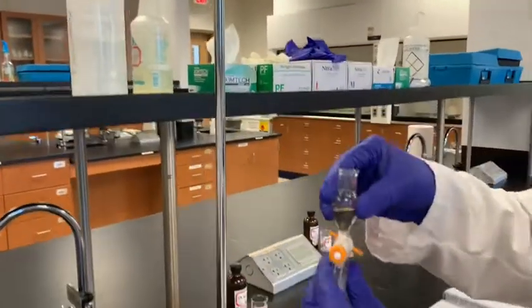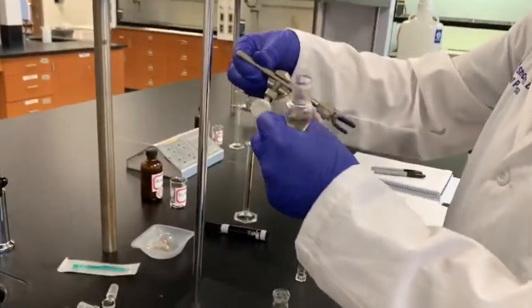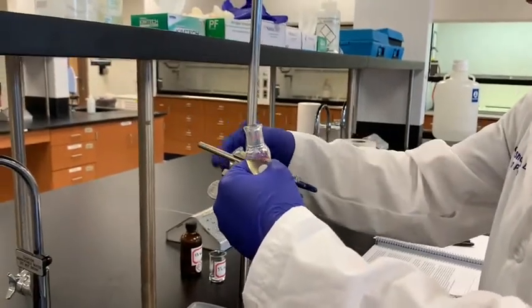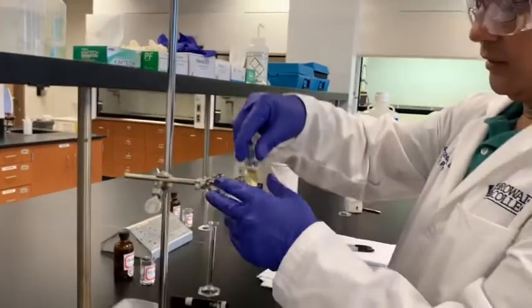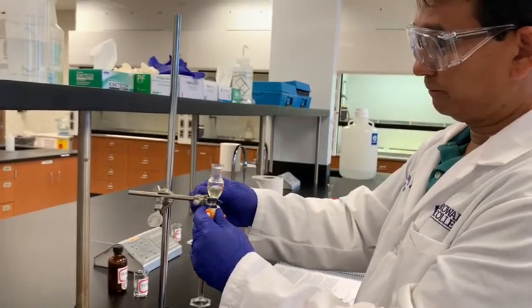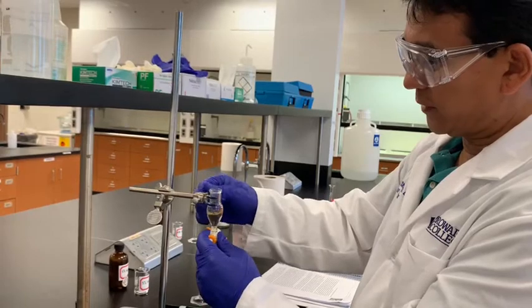But there's some aqueous layer. Let me put this in the clamp so that I can handle it a little comfortably. So 1 second here. Let me clamp this so that I can do a little more carefully. Okay. So this is where I will clamp it here. Or this position, maybe this is better here.